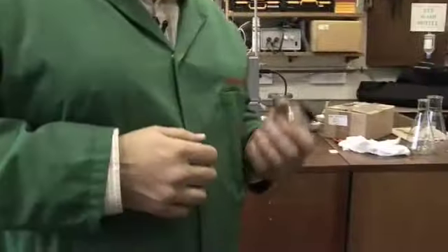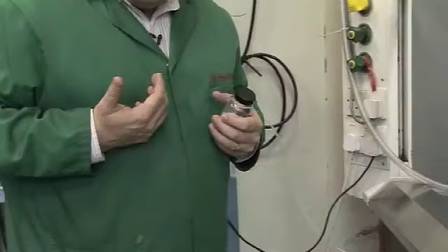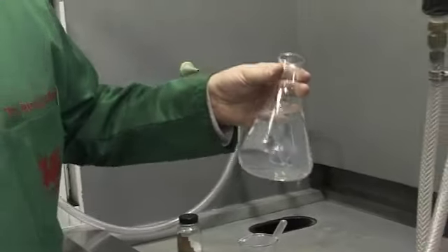So the starting material for this is our favorite silver nitrate. What we need to do first is make a salt solution. And we've done that by dissolving silver nitrate in some deionized water.